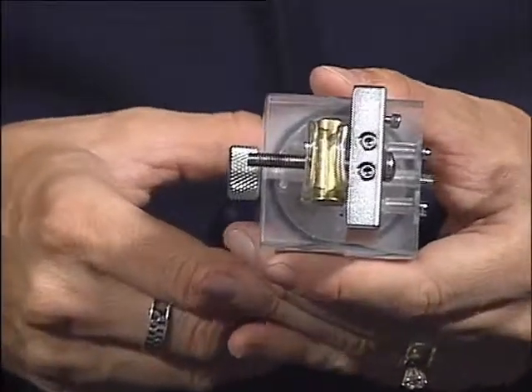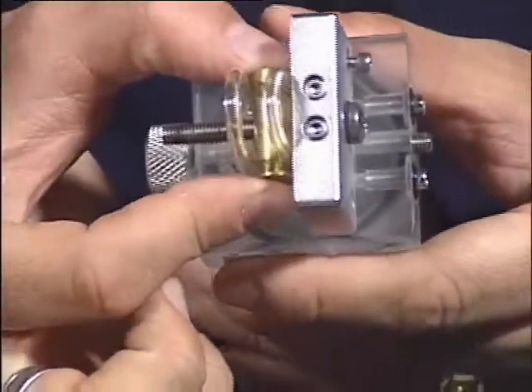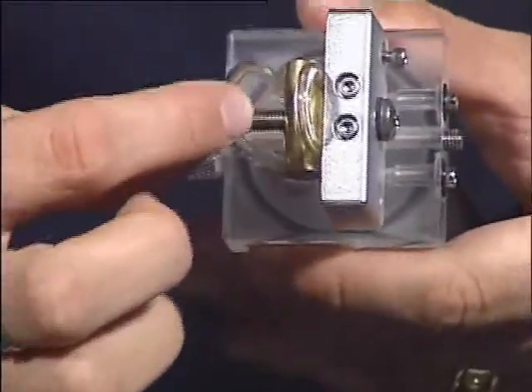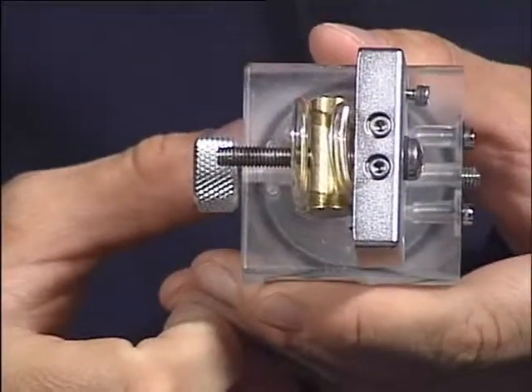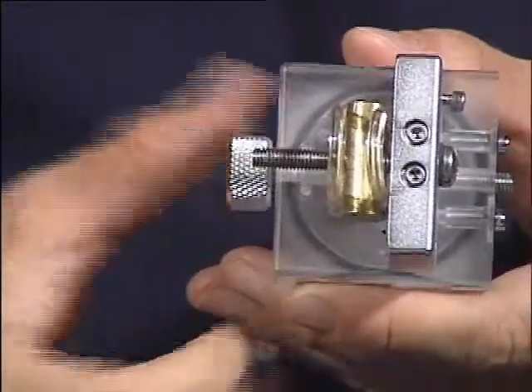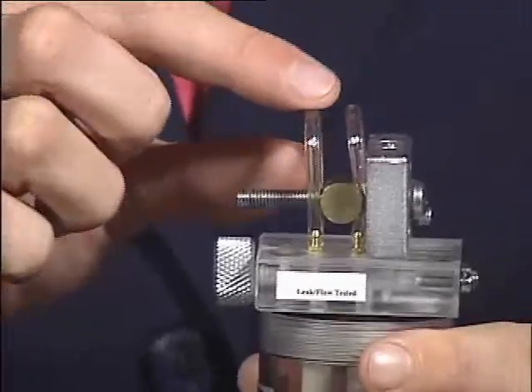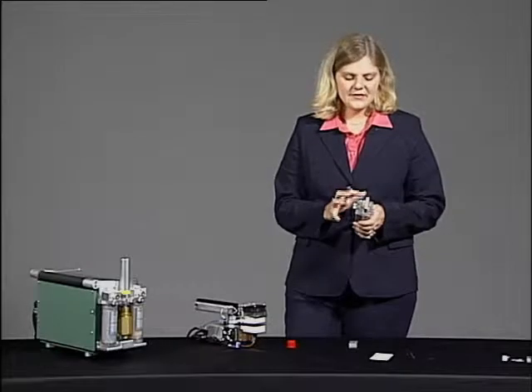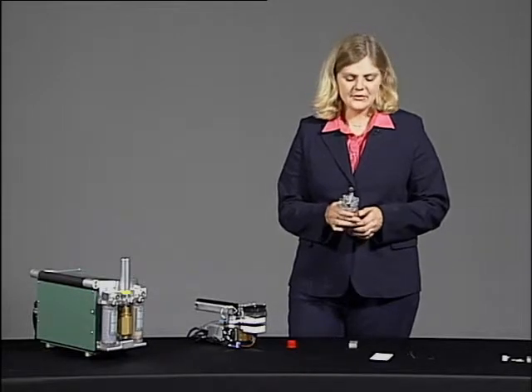When you have the scrub knob in either the full scrub or the full bypass position, this brass rod moves to crimp either this tube or this tube closed. And if you've left it that way for an extended period of time, you may find that the tubing needs to be replaced. In which case you can pull the tubing off and replace it with some spare tubing that's in your spare parts kit. And there are also detailed instructions and pictures in book 3 of the manual if you need to do this.